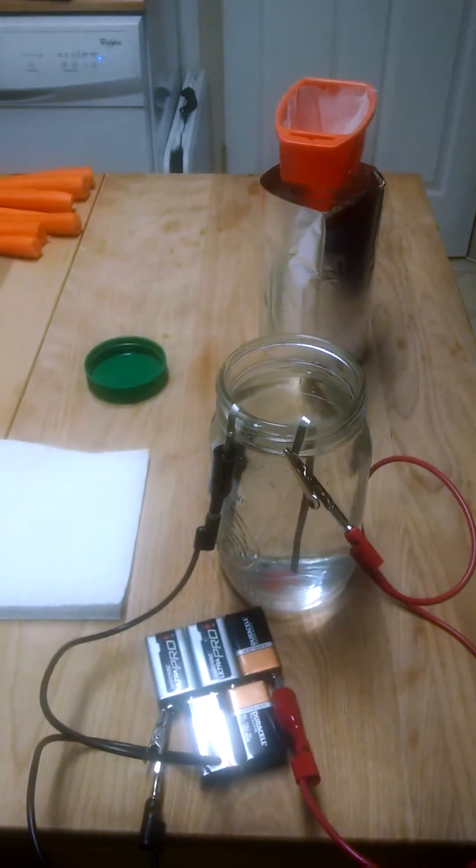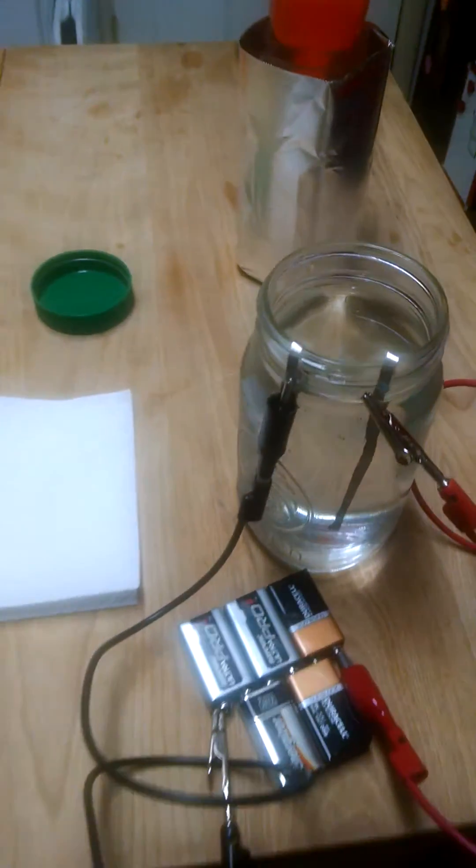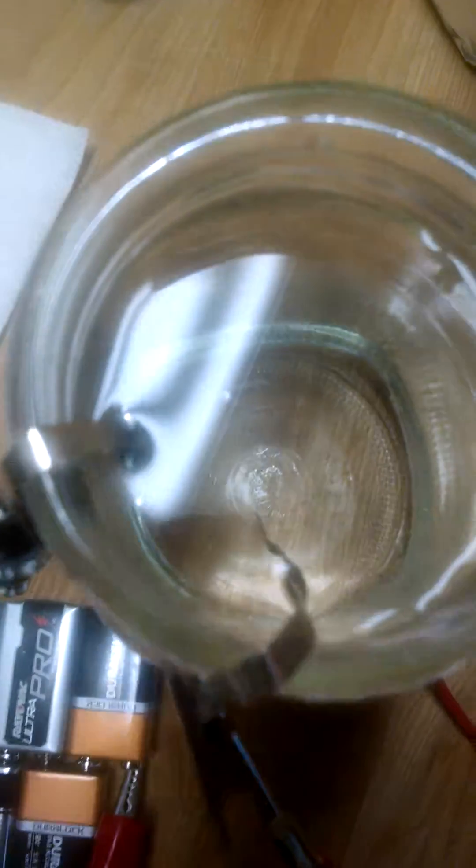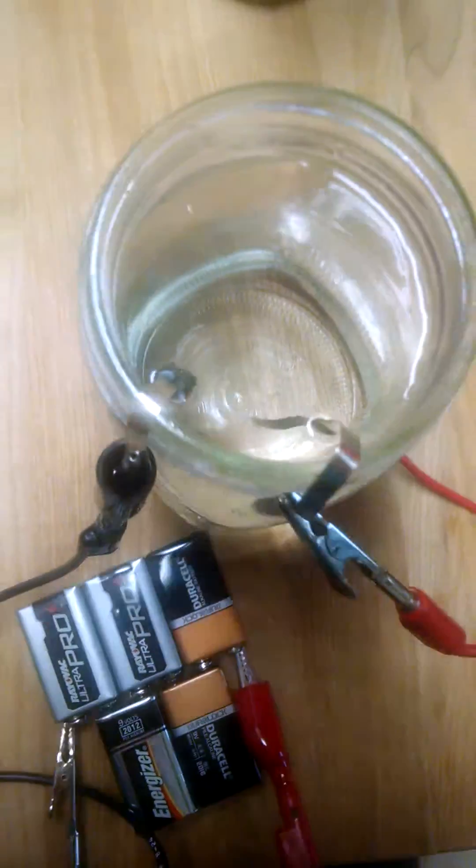Okay, so we're about just over an hour, and we've got much more mist. And our one electrode, silver lead is really getting darker, and we've got really a lot of fuzz on the other one.